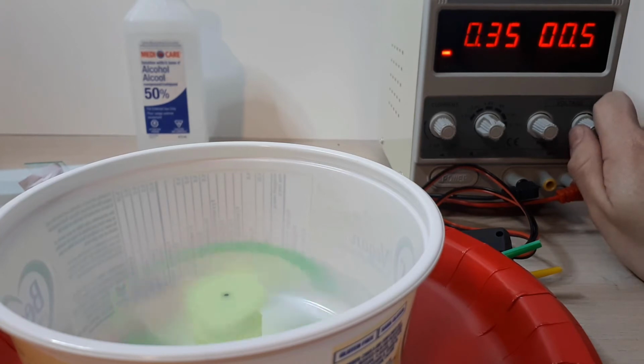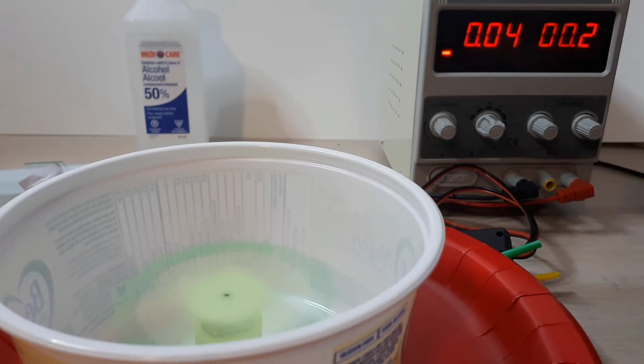Painter's tape is used here to provide a barrier from the coating, resulting in a clean area with which the slide can later be handled. A few drops of paint or nail polish are placed onto the center of the slide. For the purposes of this demo, the exact amount of paint should not have significant effect on film thickness as the excess will be flung off the slide.